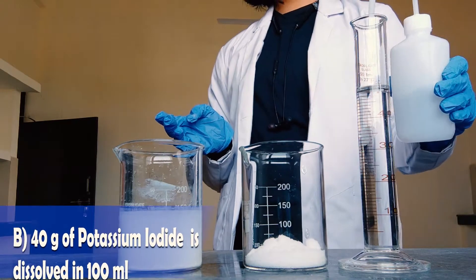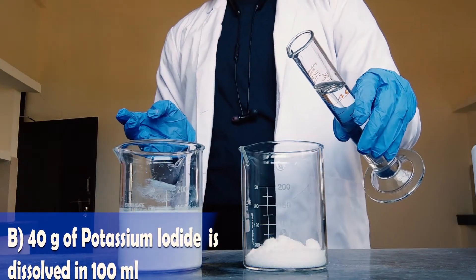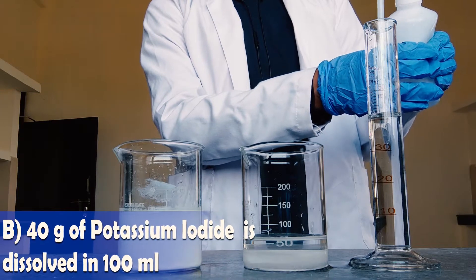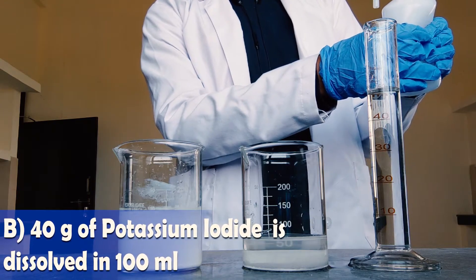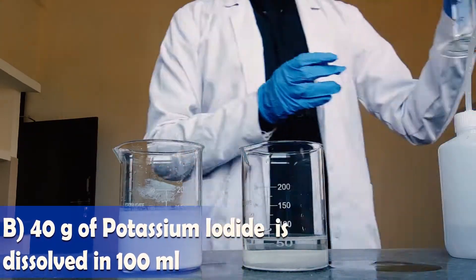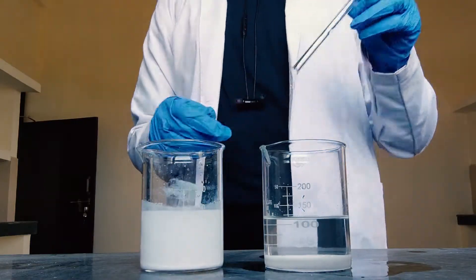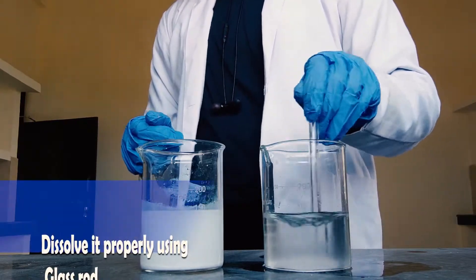Now we are preparing solution B. As you can see, the second beaker has 40 grams of potassium iodide in it. You have to dissolve this 40 grams of potassium iodide in 100 ml of water. With the use of a measuring cylinder, add 100 ml of water to it. You can use a glass rod to dissolve the potassium iodide.